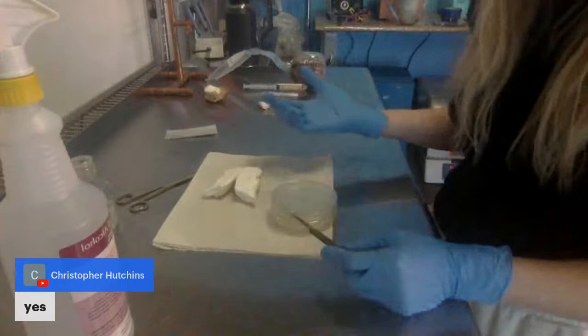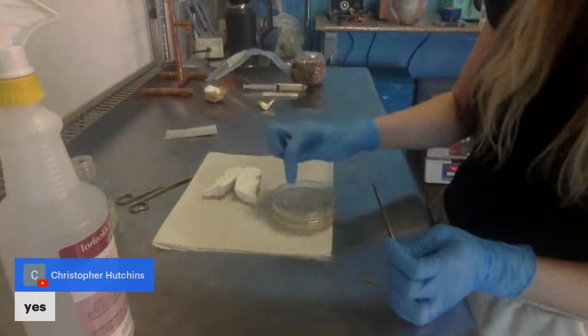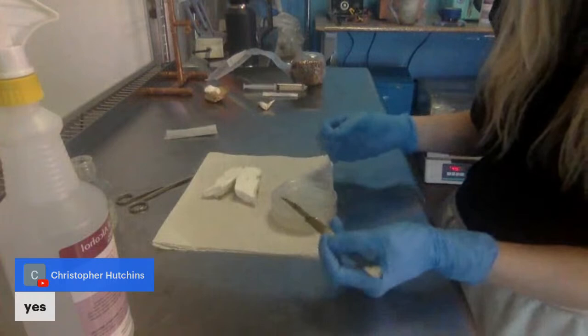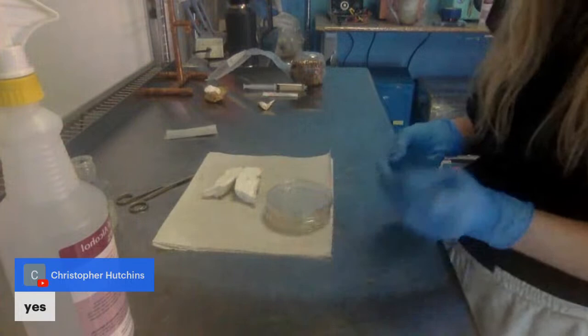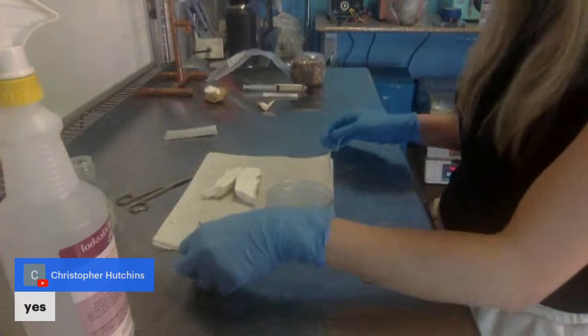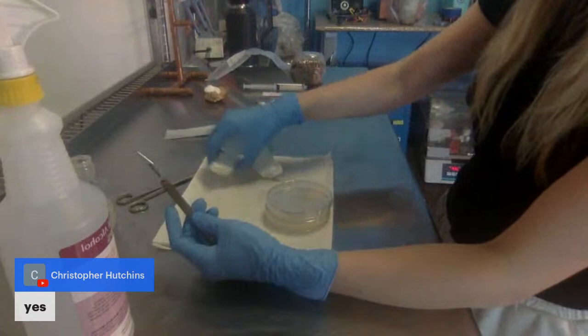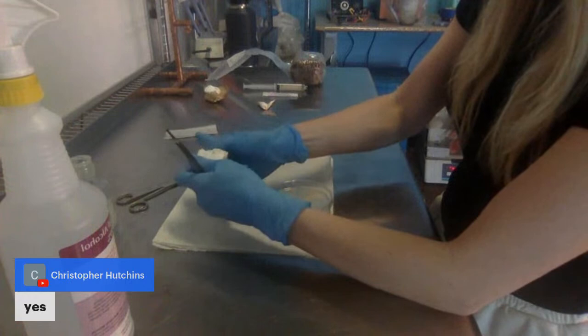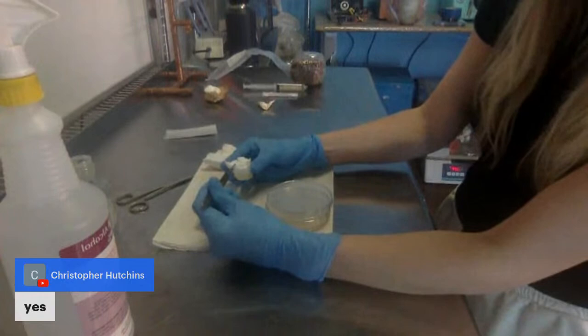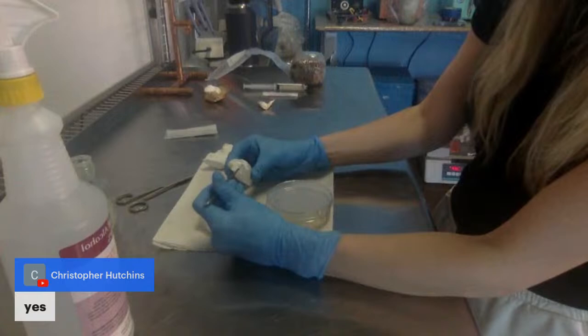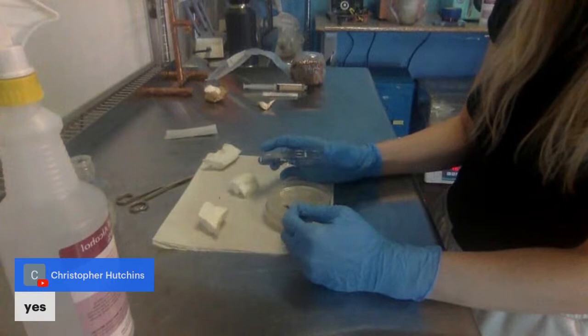You don't need much at all. Even a microscopic amount will be enough to clone. But just cut a tiny piece like this. After I cut it out of the matrix, I usually stab it. Got my plates here. Then I clamshell the plates away from me. Just do that, wipe it on the agar, and hopefully it drops off your blade quickly and sits on the agar.